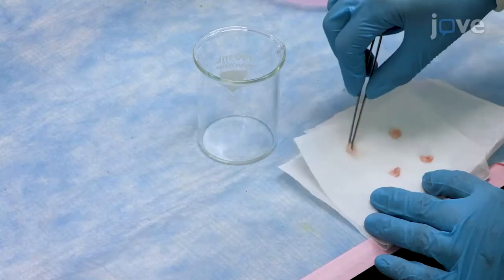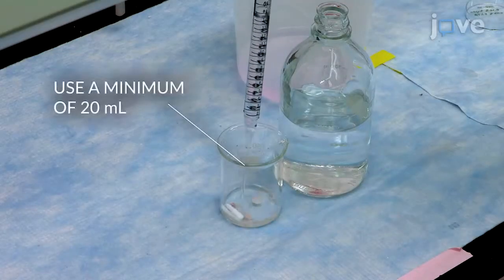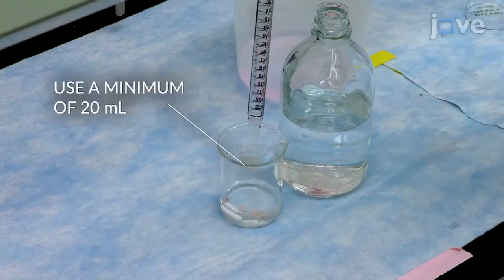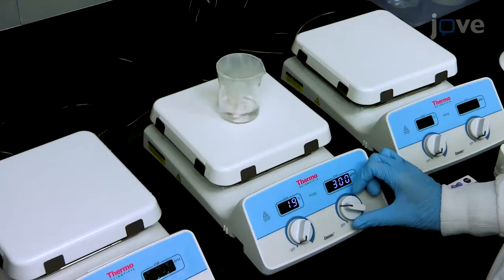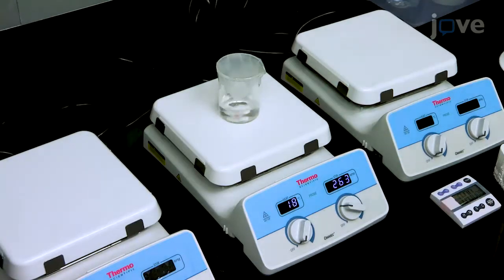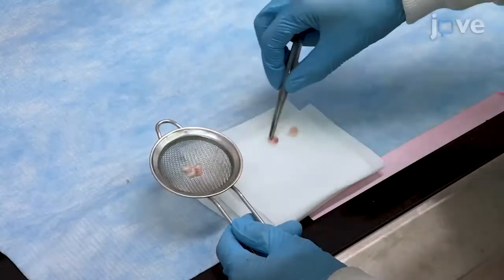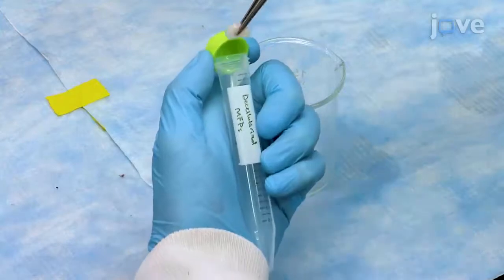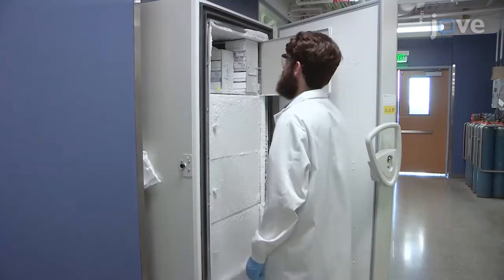Place the contents back into the beaker and wash the tissue by covering it with 60 milliliters of deionized water per gram of tissue. Stir at room temperature for 15 minutes. Repeat this wash process 3 times. After this, briefly dry the tissue on a delicate task wipe and weigh it. Transfer the tissue to a labeled 15 milliliter tube and freeze at -80 degrees Celsius overnight.